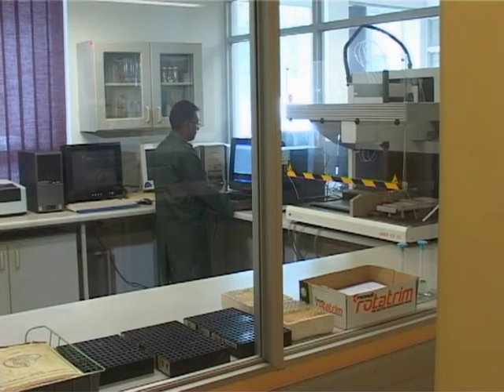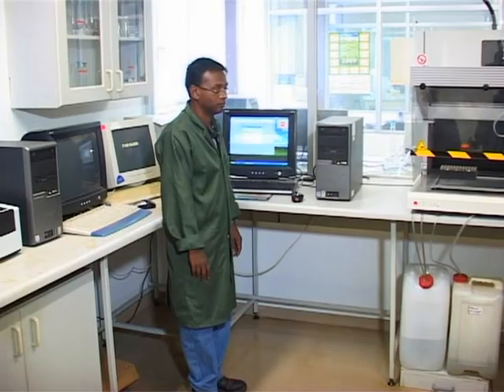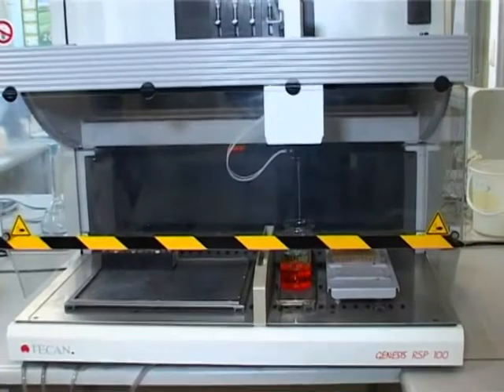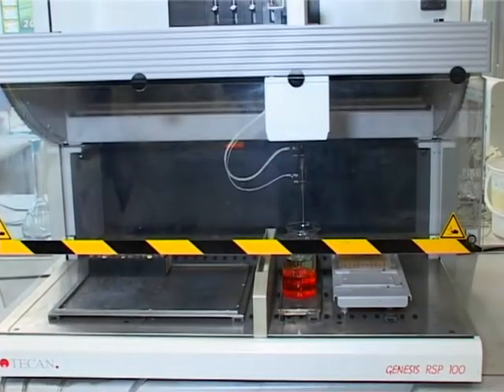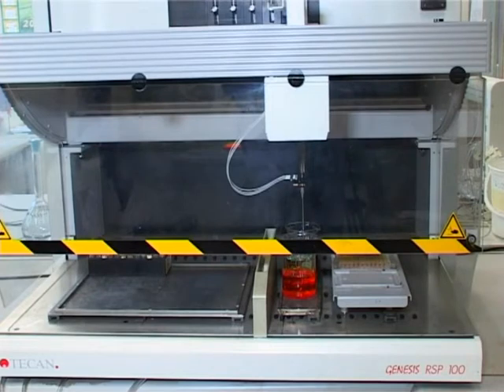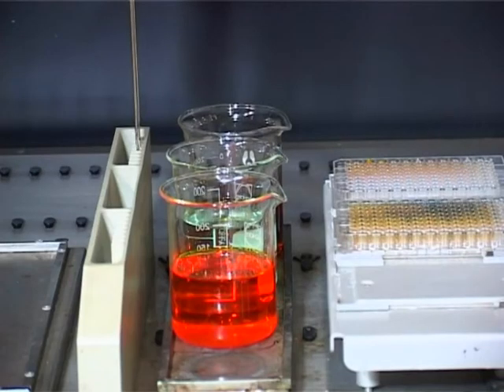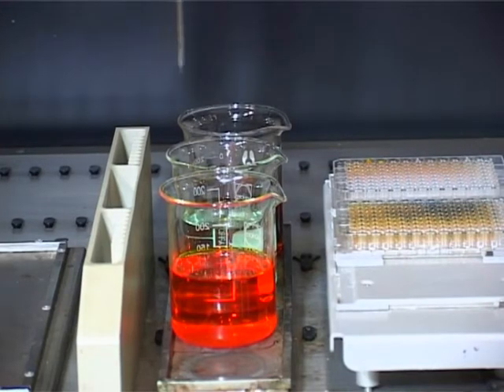This is one of the instrument rooms, where sample processing is completely automated. We use this process to analyse the soil phosphate, silicon and sulphur. Silicon is now included as a routine determination for all soil samples.